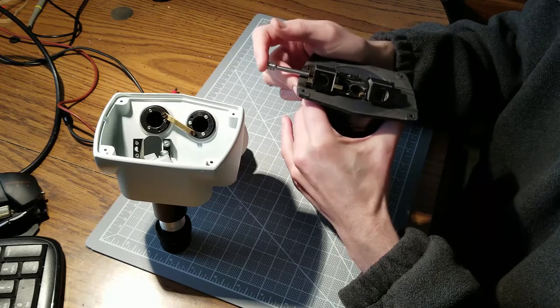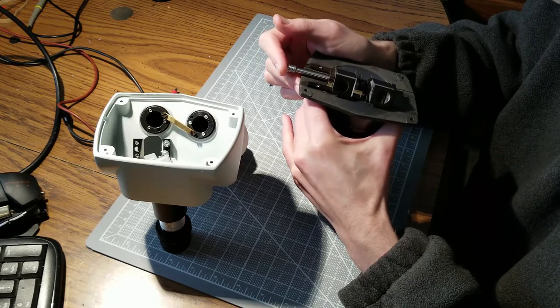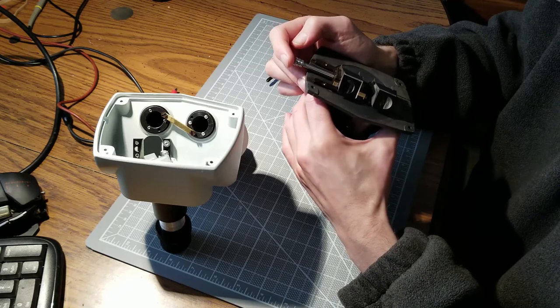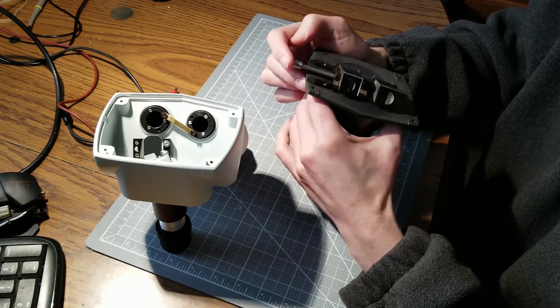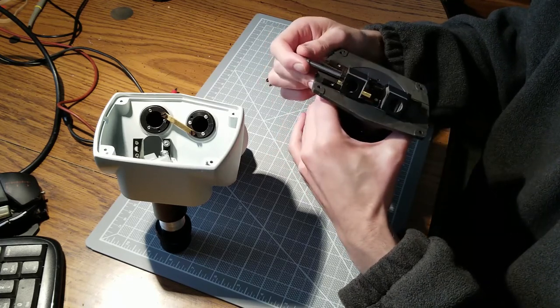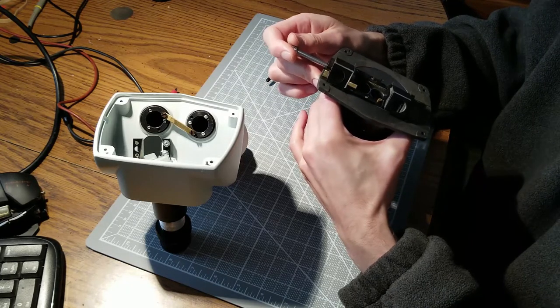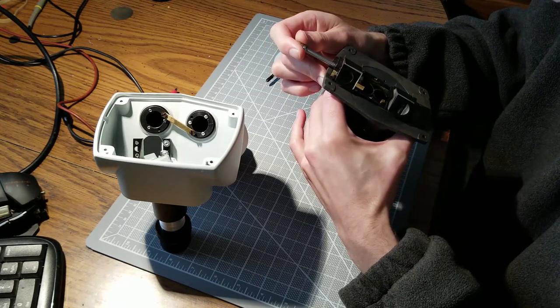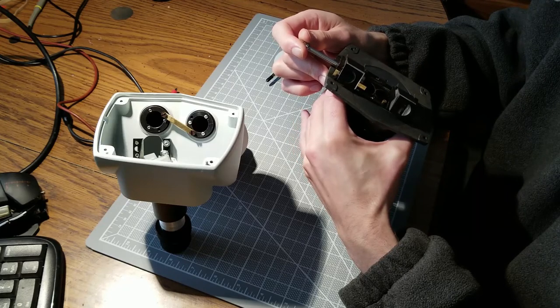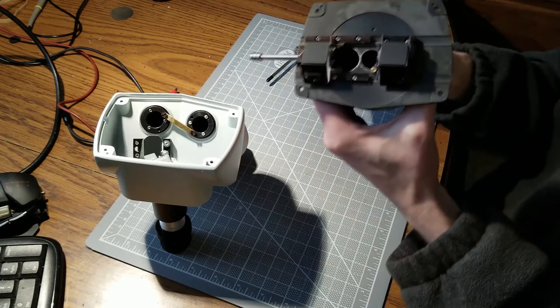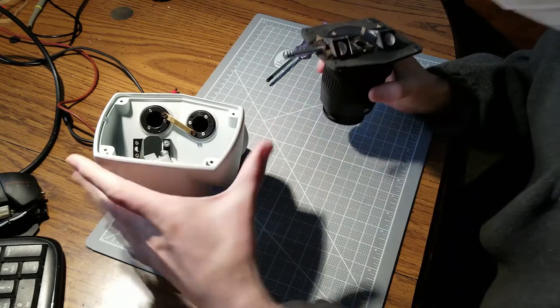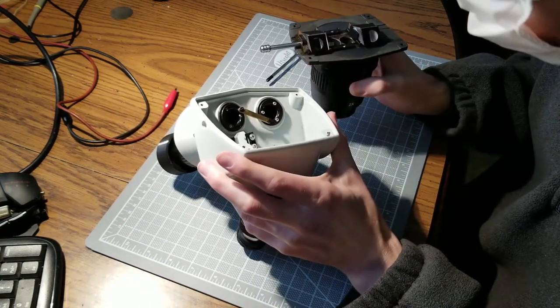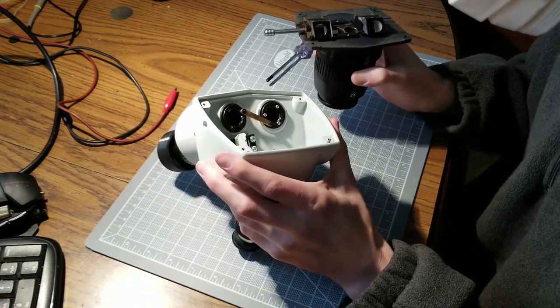light is able to travel through the port and onto the mirror in the white housing part. And that goes to the camera or whatever you have mounted where the camera would normally be mounted.